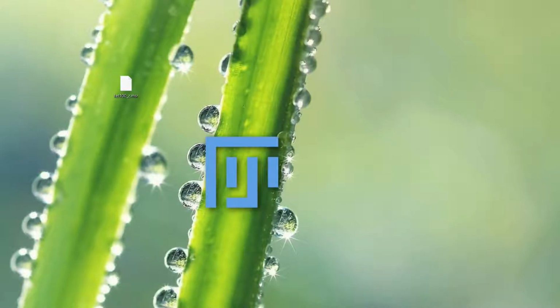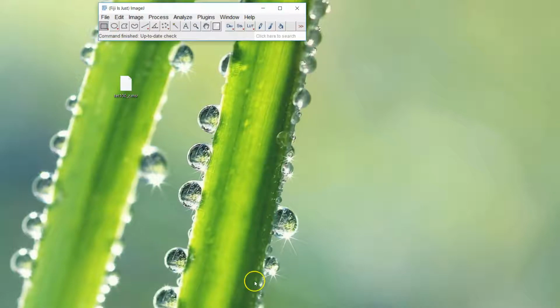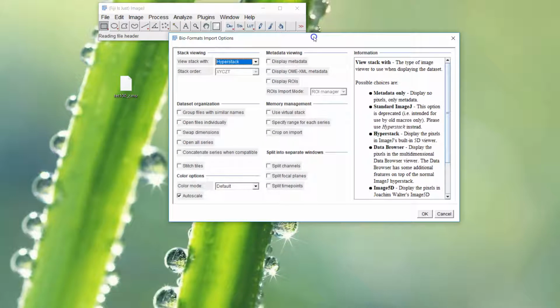Okay, so we're going to do a quick one on using Fiji to open the MSR files from Abberior from the STED demo. Download them, keep them local somewhere on a hard drive, and always keep your duplicates and back up your data, and then drag and drop, and you should see this window come up.